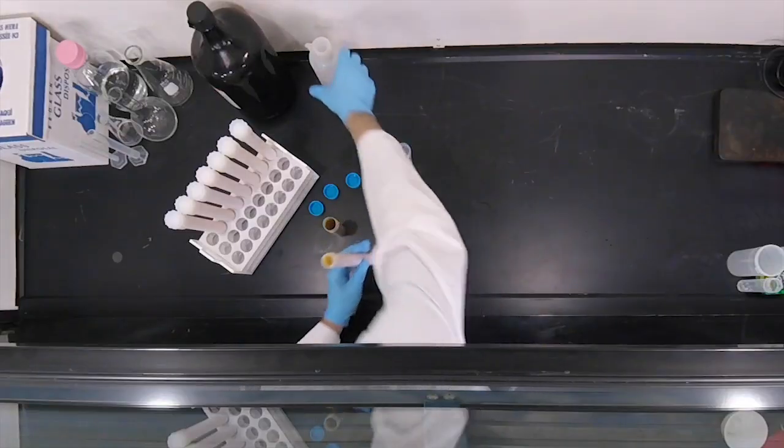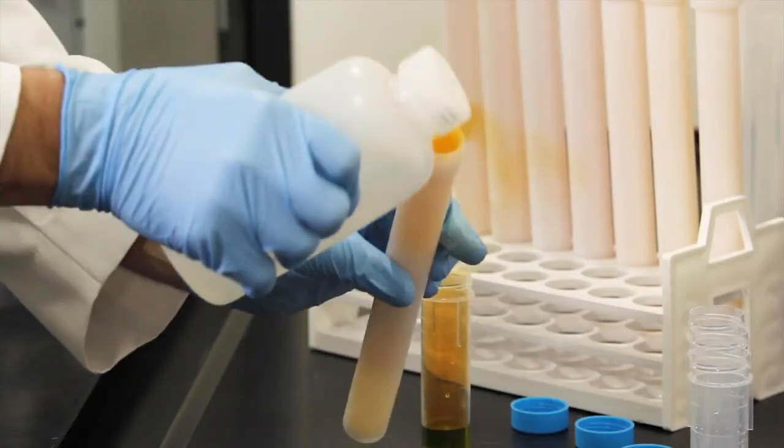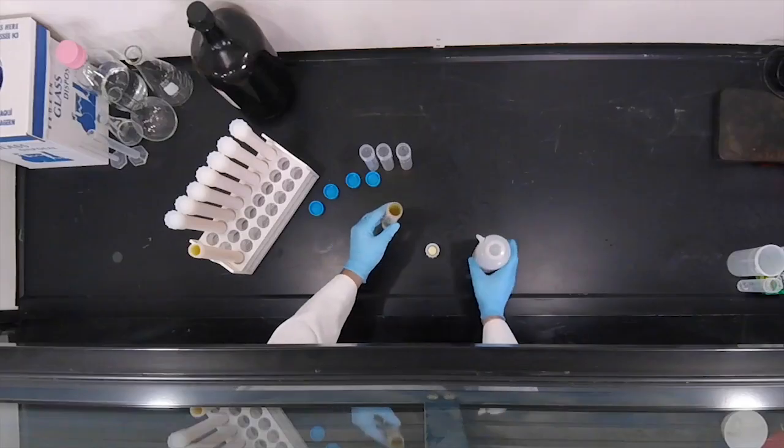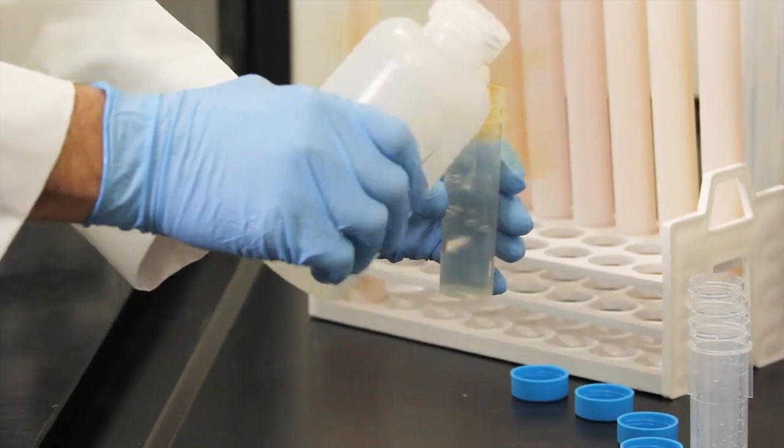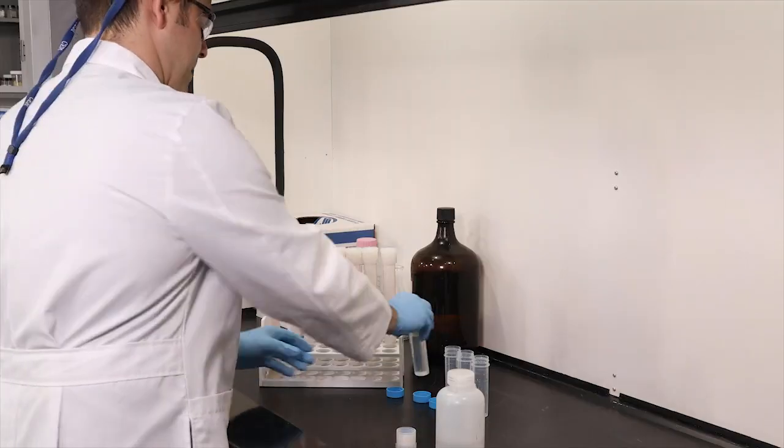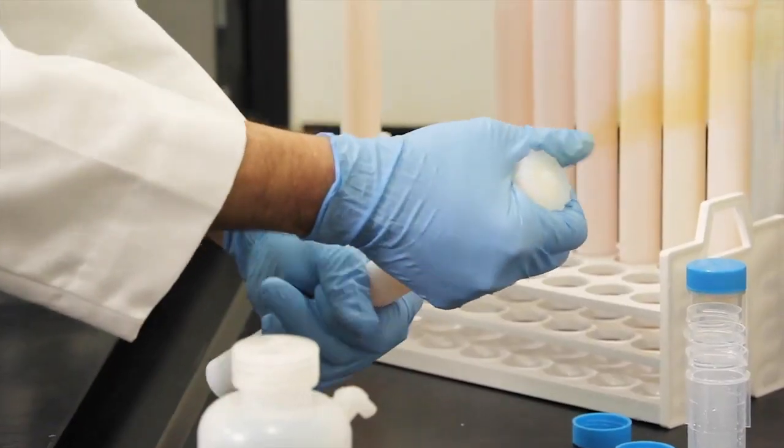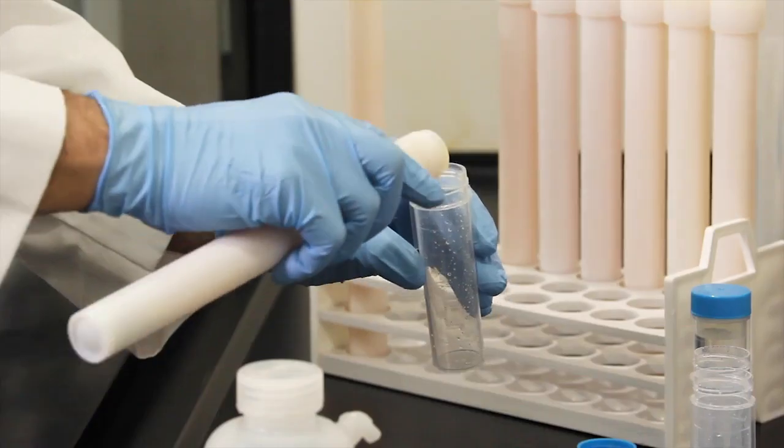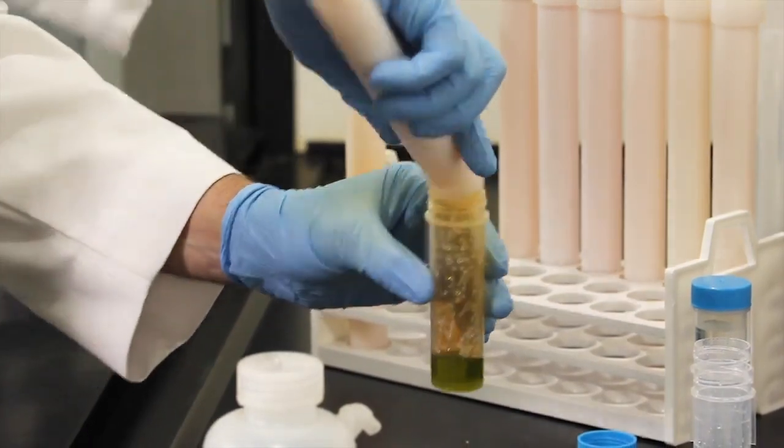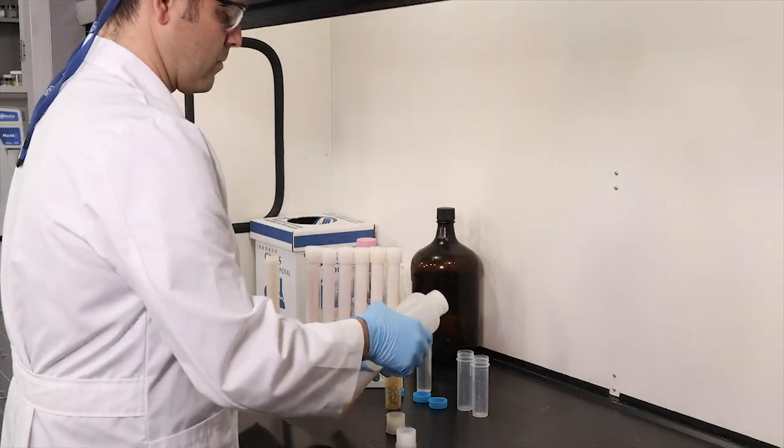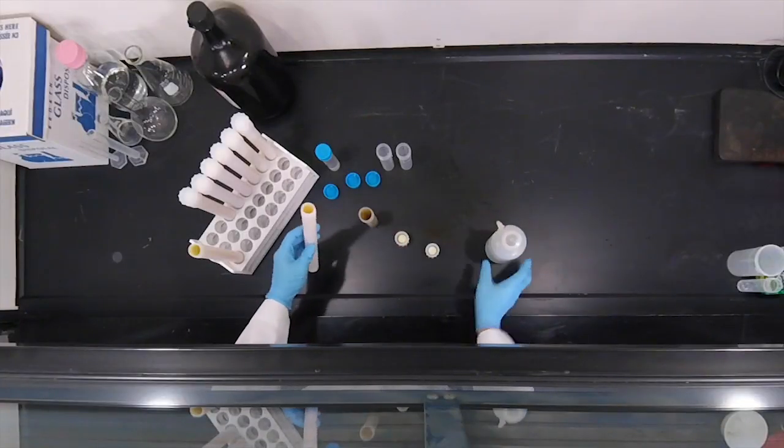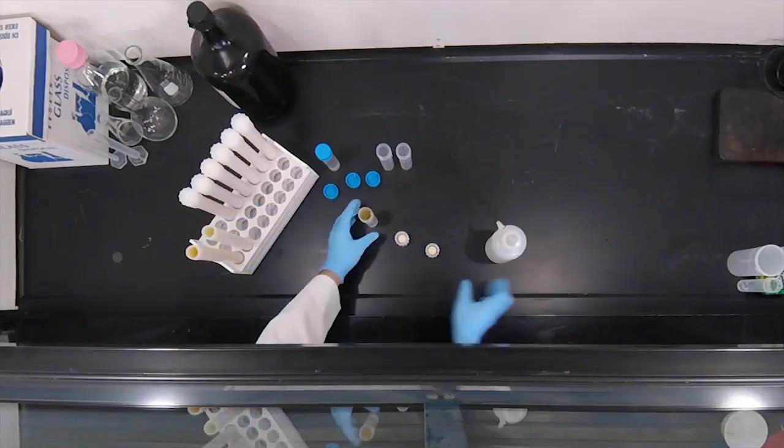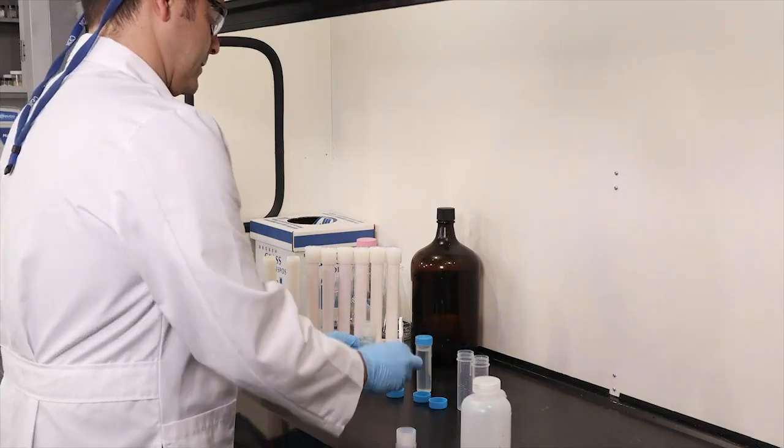All right, do a little bit of transfer here, get all the good stuff out. Everything looks good there. So let's move on to our basketball. Oh, very good. Hopefully you got a chance to hear that. Let's take a look. Very nice. Let's bring this up to our 50 mil. While I keep doing this, let me wrap this up and I will meet you over at the bench in a few minutes.